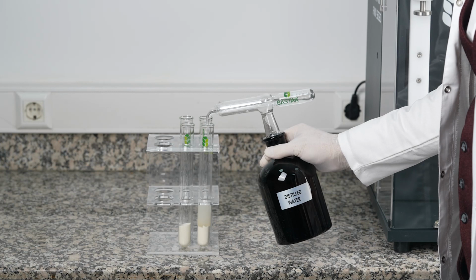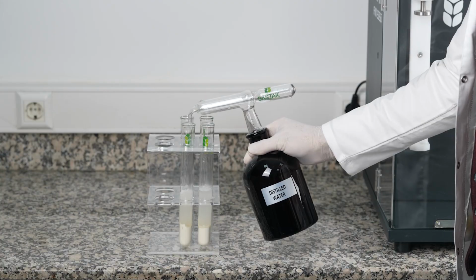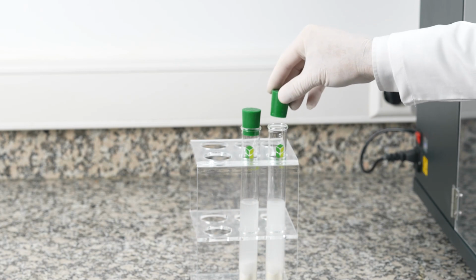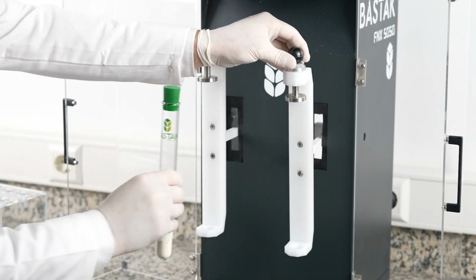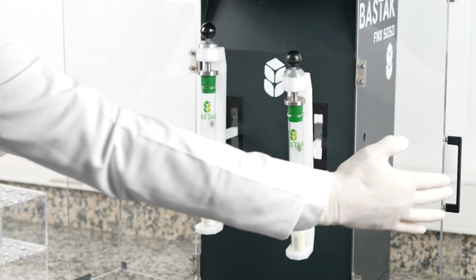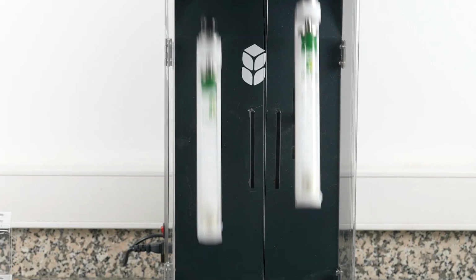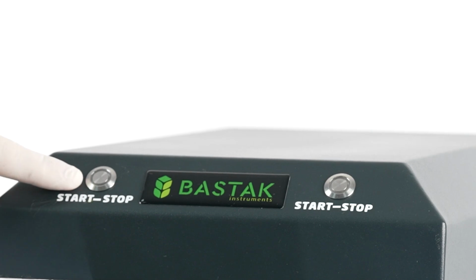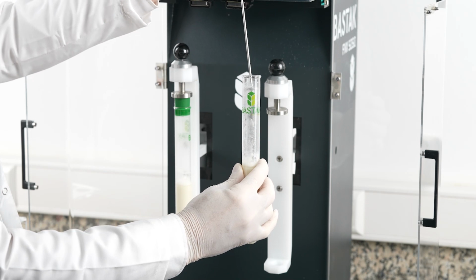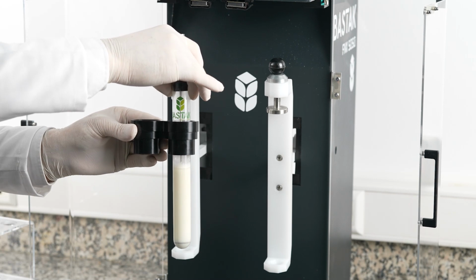Add 25 milliliters of pure water at 22 plus or minus 2 degrees Celsius to the samples using an automatic pipette. Close the mouth of the test tubes with a stopper and shake for 20 seconds. The tubes are shaken 50 times each with the Bastak brand FNX 5050 model shaker. Afterwards, the samples remaining on the walls of the tubes are pushed into the tube by scraping with the round metal piece under the test rods, and the tubes are placed in the tube holder.